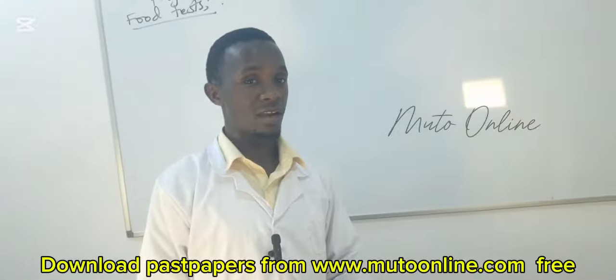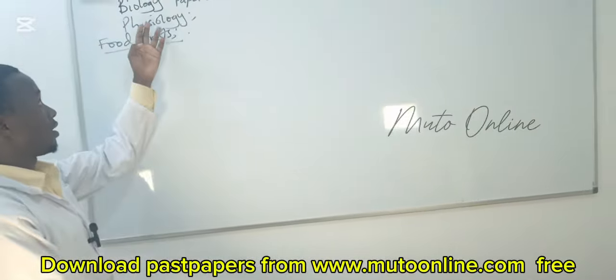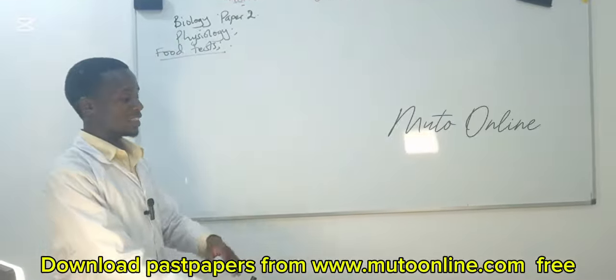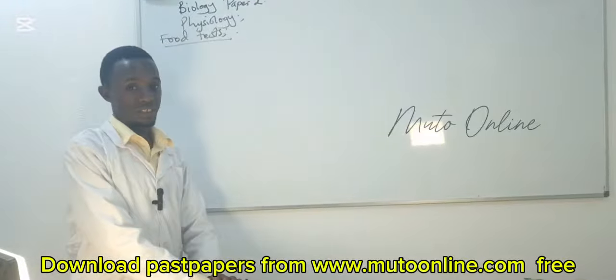Today I'm here to take you through some biology, paper 2, an item from physiology, and specifically from food tests.